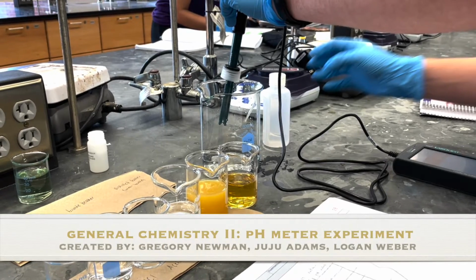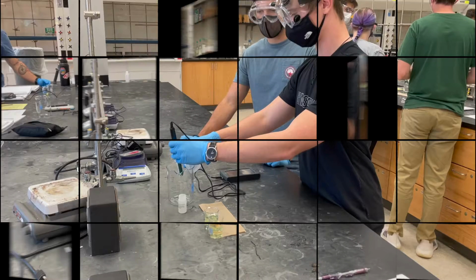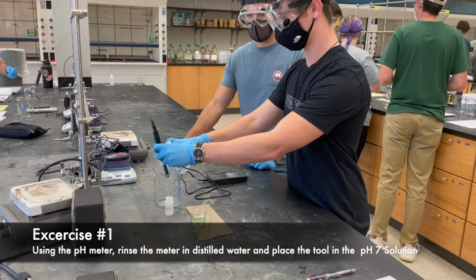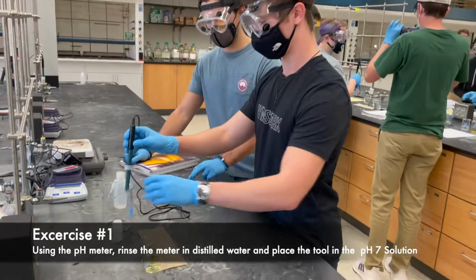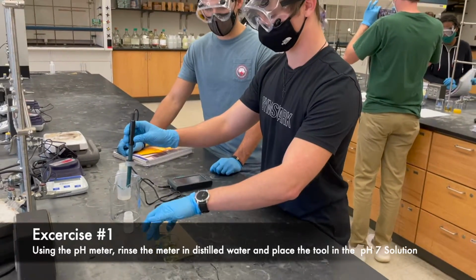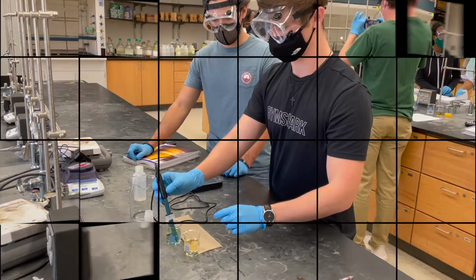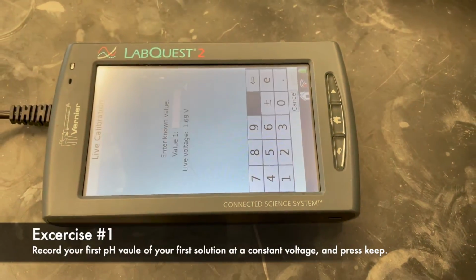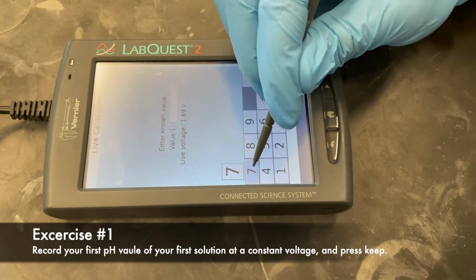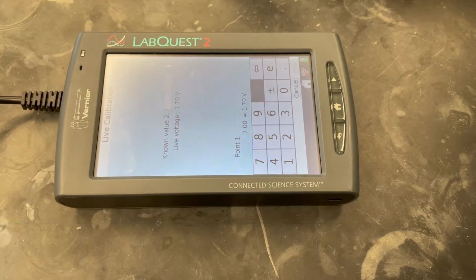Welcome to our pH meter experiment for General Chemistry 2. The first step to using a pH meter is to calibrate the equipment to correctly measure the pH of your solutions. You'll use a solution with a pH of 7 and a pH of 4, rinsing after each measurement of a different solution. Then enter your corresponding pH value to the tested solution into the provided box and press Keep. You'll repeat this process for both solutions.